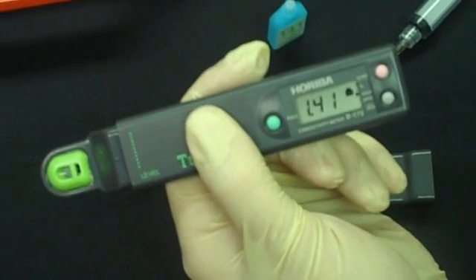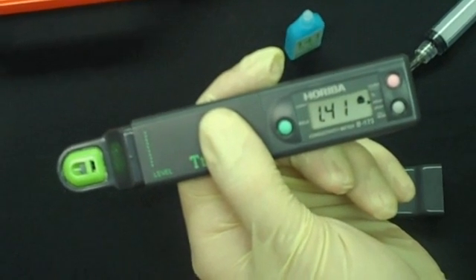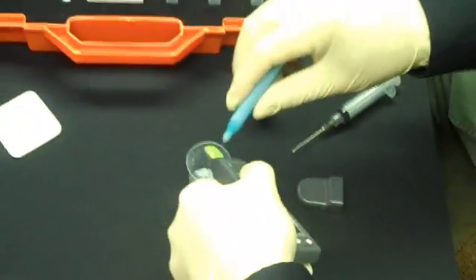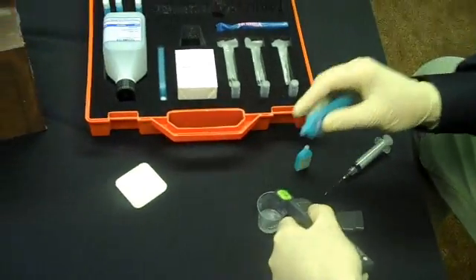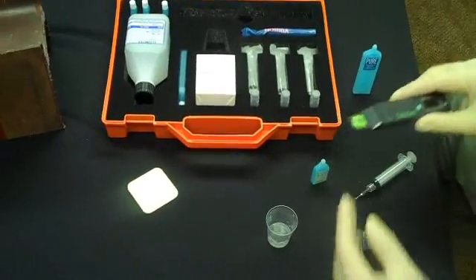The CAL signal will appear on the screen, and after a few seconds it will disappear, meaning that the gauge is now calibrated. We can just rinse that off with some deionized water. Now, set this aside for later.